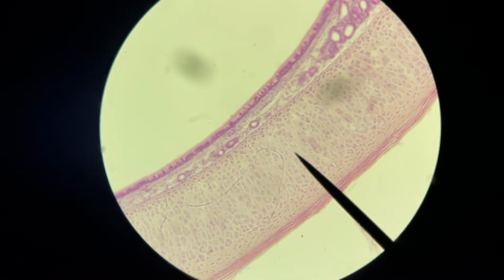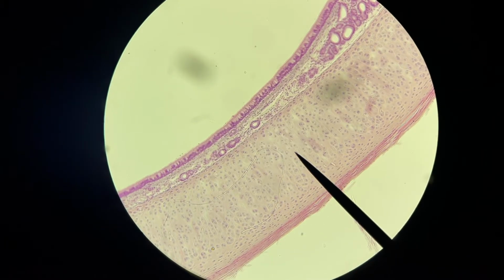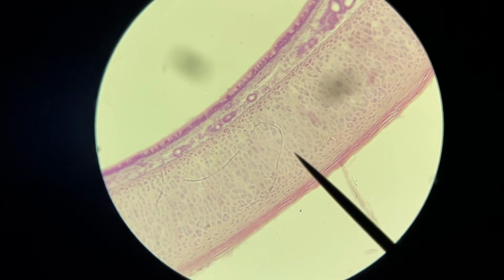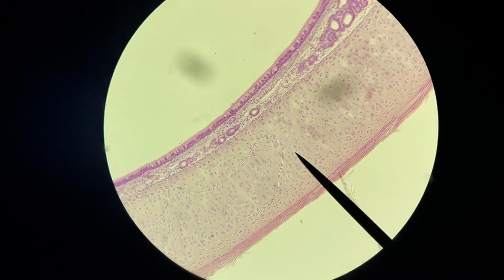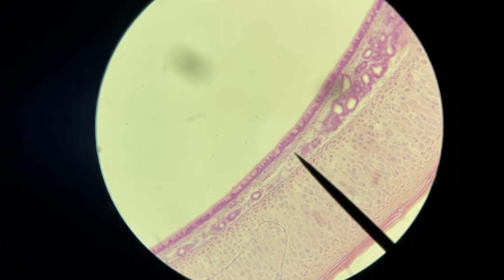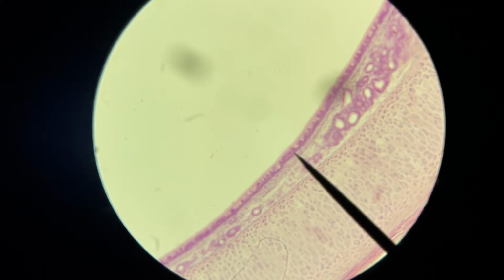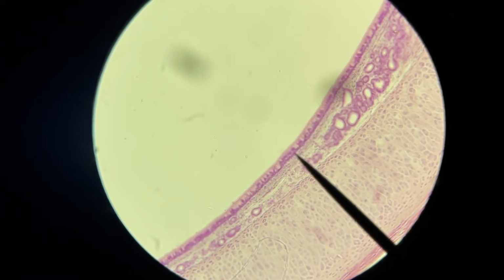Now you can see that we're on the hyaline cartilage, the band of hyaline cartilage. And the smooth muscle is that pink band just below. I'll back this up. So there's your smooth muscle. Here's your hyaline cartilage. This is connective tissue, and to the right of the pointer, some glandular tissue. And right there, that is the tissue sample we want to look at up close and in detail. That's our pseudostratified columnar epithelium, but it's still at a lower magnification than we need to really observe this properly.